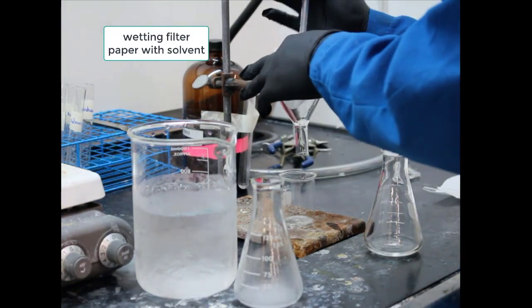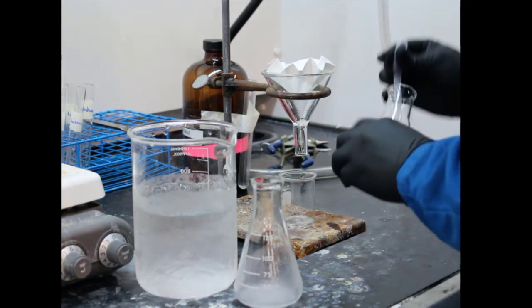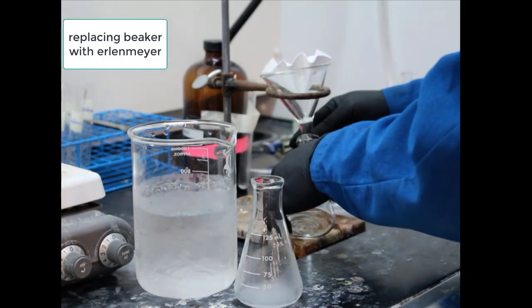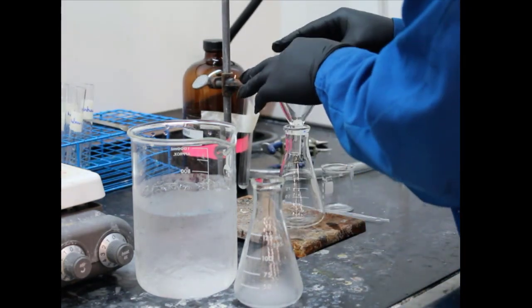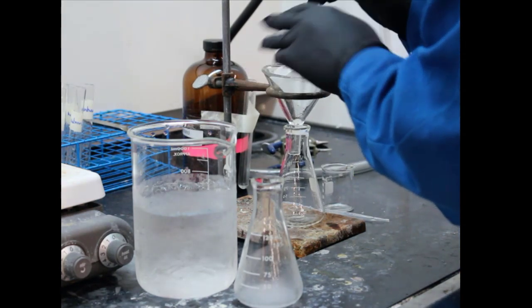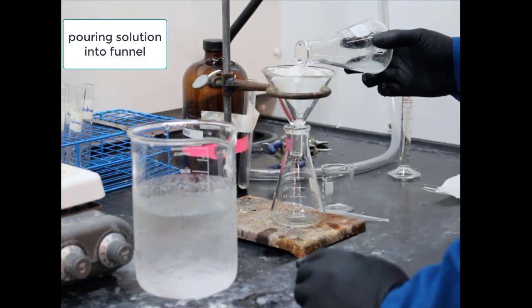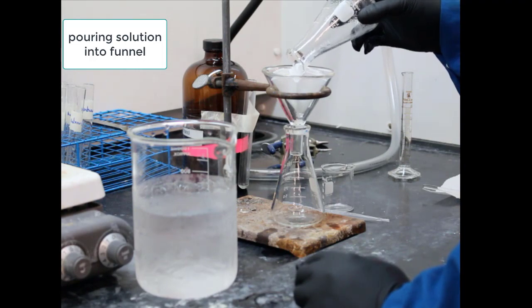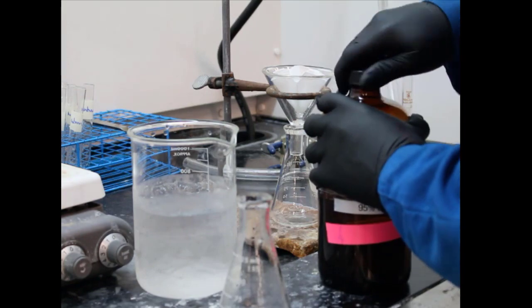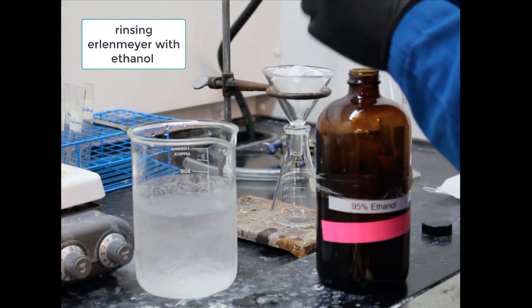All right, so they go ahead now. Whenever they pour this solution with cloudiness in it, the solid they're going to catch is that recrystallized unknown. So pouring it through, going to rinse it a little. And now just to make sure they catch any of the unknown that stuck to the side of the flask, they're using ethanol.